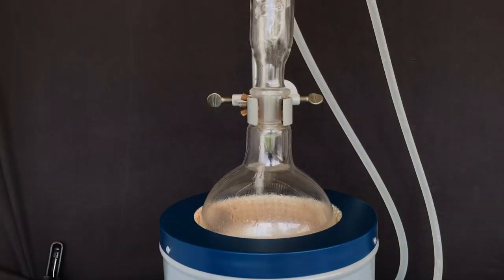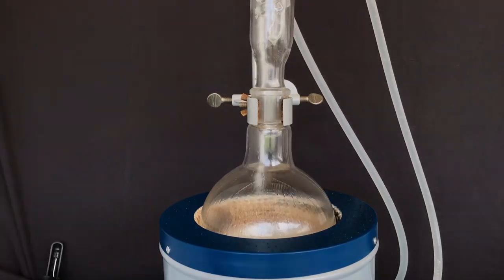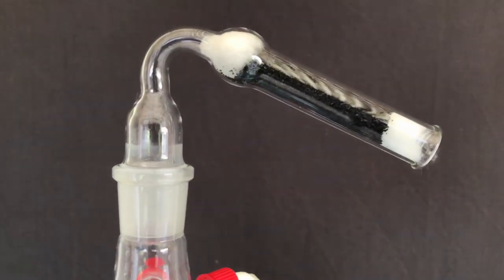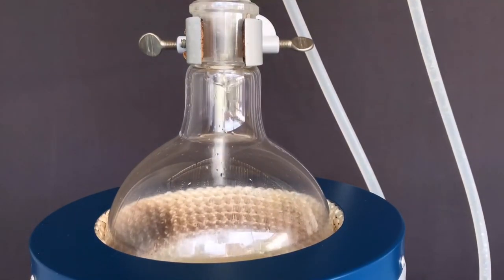We refluxed for some time, but as the HCl evaporation became too aggressive, an activated charcoal-filled drying tube was used instead of the hose adapter. This also worked for some time until the cotton ball fell out, making a huge mess.